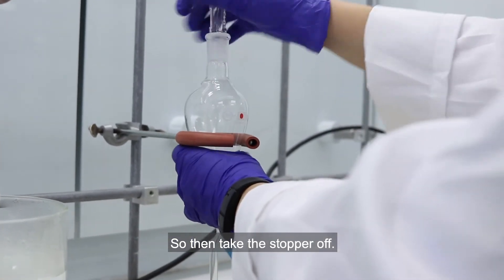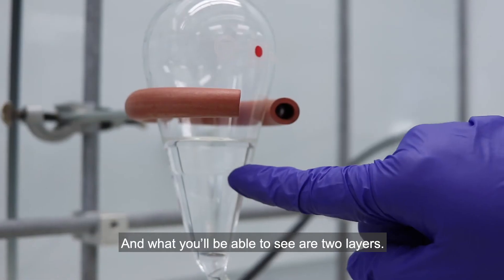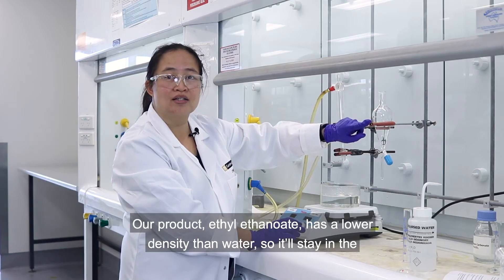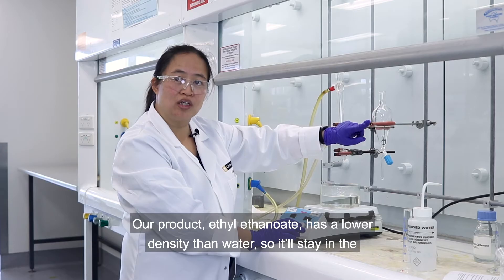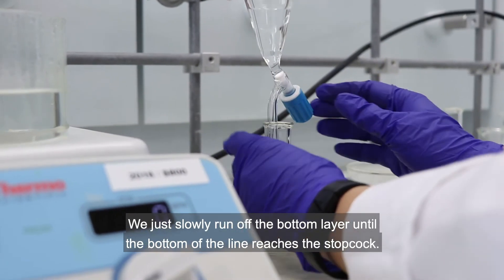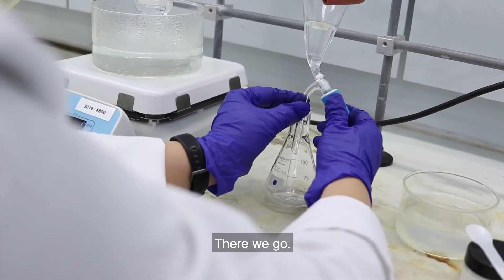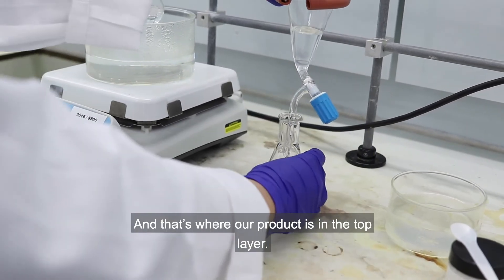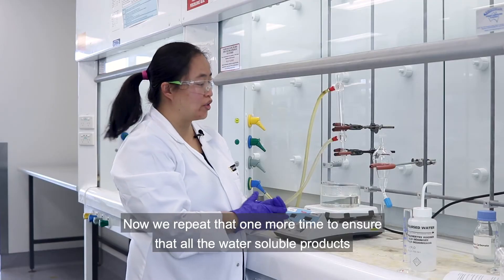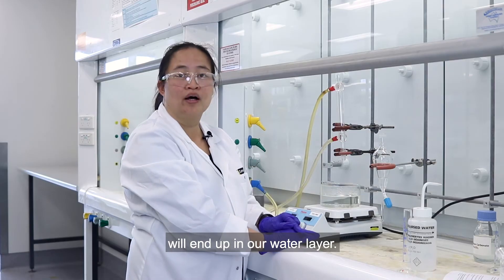Take the stopper off and you'll be able to see two layers — a bottom layer and a top layer. Our product, ethyl ethanoate, has a lower density than water so it will stay in the top layer. We slowly run off the bottom layer until the bottom of the line reaches the stopcock. And that's where our product is, in the top layer. We repeat that one more time to ensure that all the water-soluble products end up in our water layer.